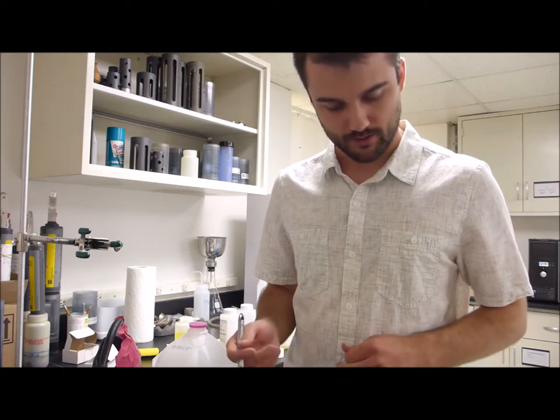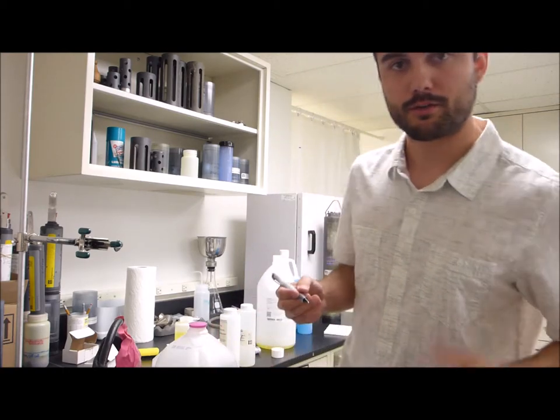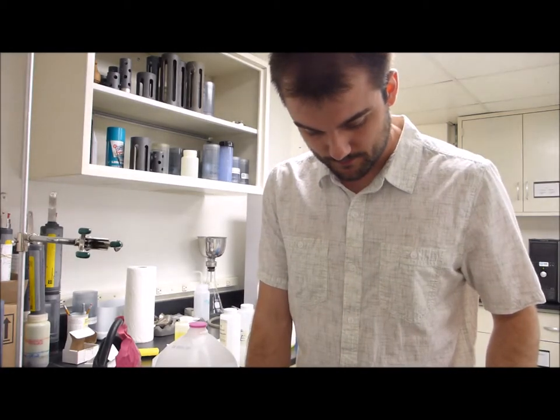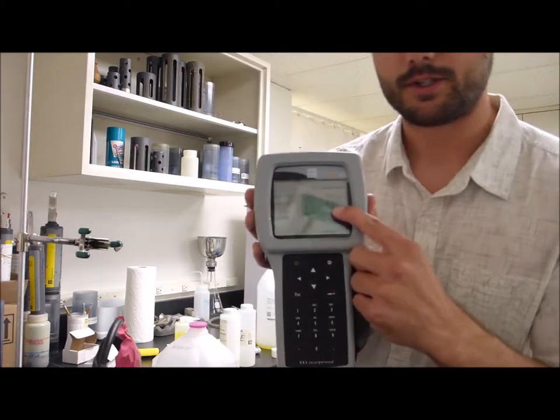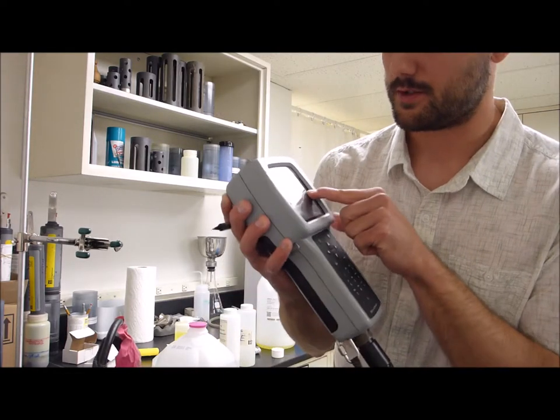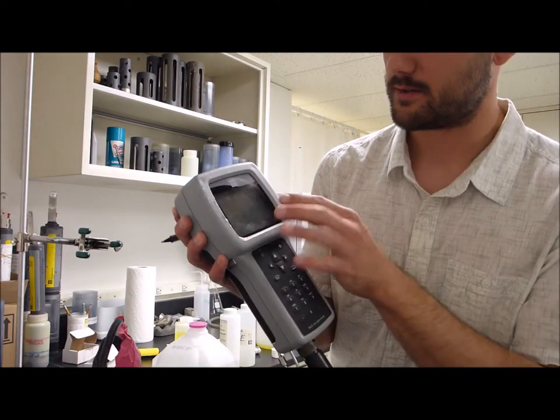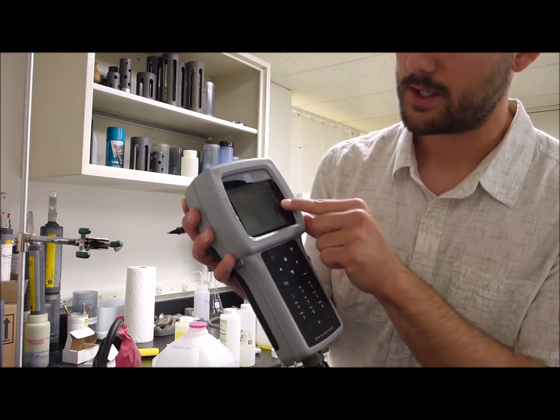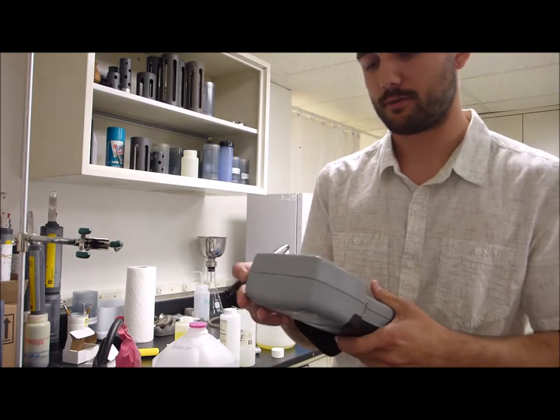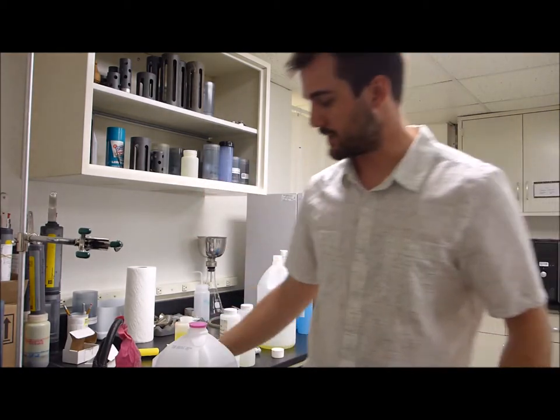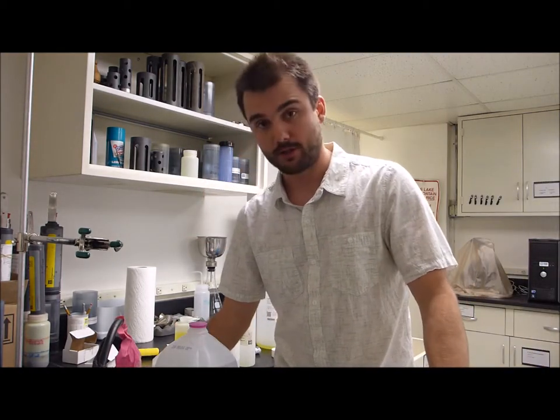So 7.07 is what I'm going to go with for the pre. I'm going to hit calibrate. It locked in at 7.02. It should lock in right around that value, plus or minus 0.01. And below the pH value, which shows 7.02, 7.01, it's going back and forth right now. Negative 38.6, 0.5 now is what it's reading for the millivolts. So I'm going to go ahead and write that down in the millivolts range.